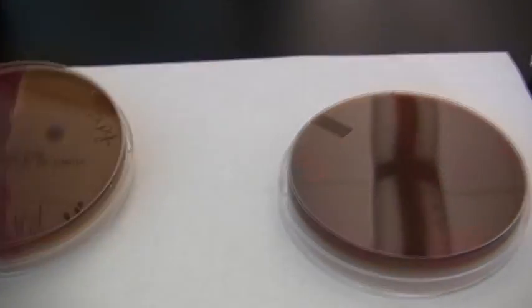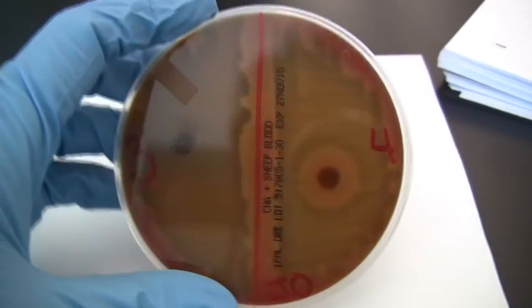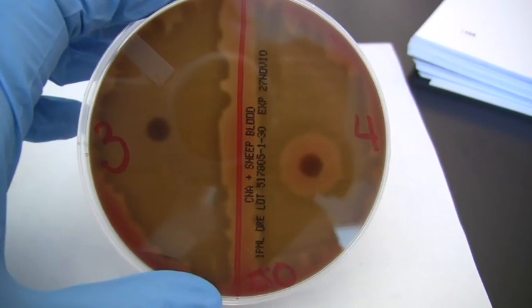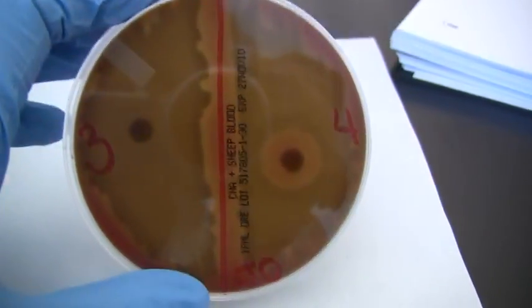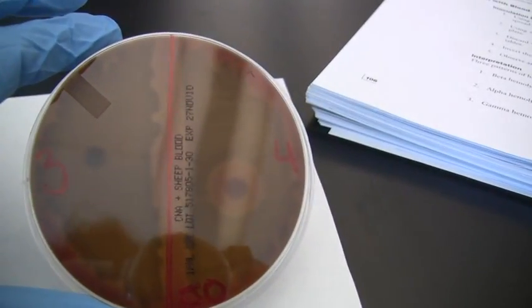Now looking at other antibiotic discs and also a different type of reaction, now we're going to look at a partial hemolysis, or what we call an alpha hemolysis. This is different than beta because there's a partial blood digestion. Blood isn't completely broken down, and we see a greenish cast. Now again, I'm going to compare this by putting this up to our newsprint. Really can't see through it here, but we certainly can see that the blood has changed and it's partially broken down. Again, a key is to look through the bottom on alpha hemolysis, otherwise you may get off track on the type of hemolysis that's occurring.